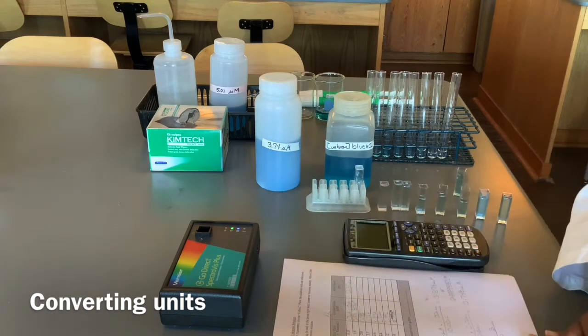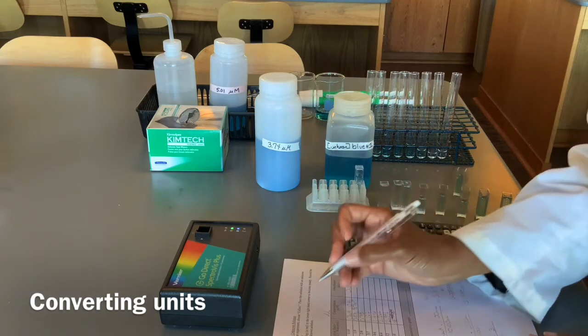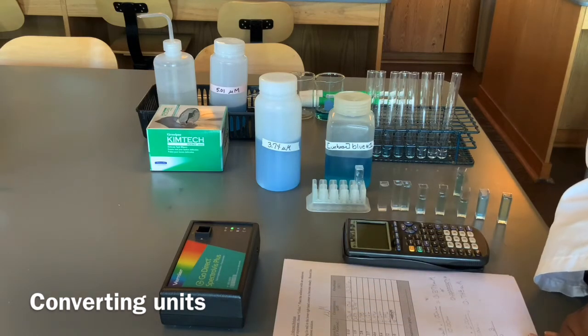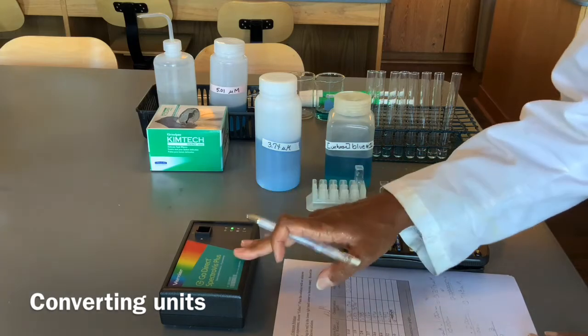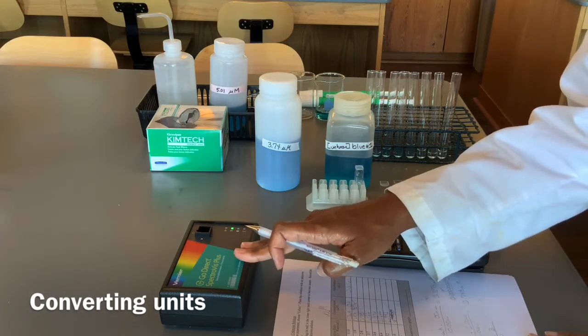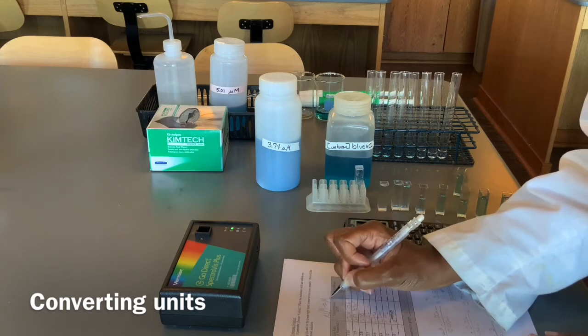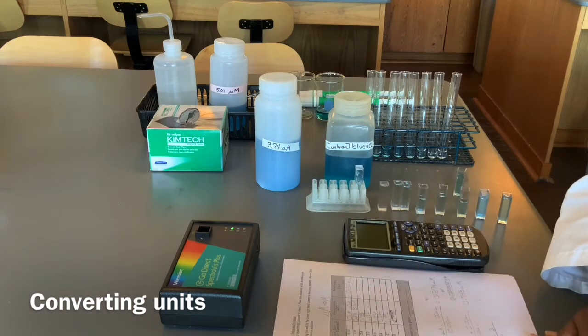Micro, the Greek letter mu, is used to represent micromolar, which means micromoles per liter. But the unit that we will be entering into our spectrophotometer is molar, or moles per liter.